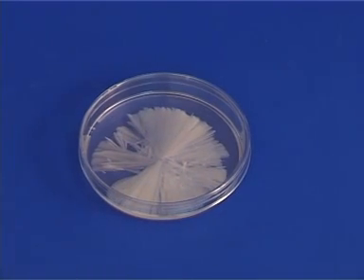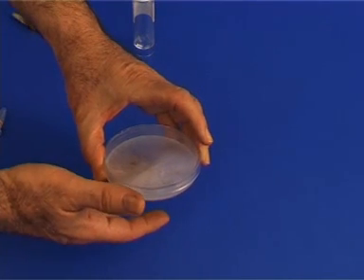After crystallization has occurred, touch the bottom of the petri dish and note that it is warm.